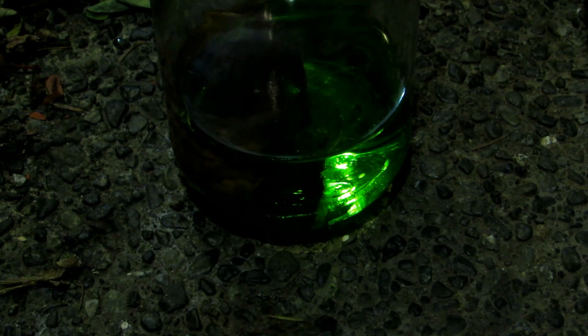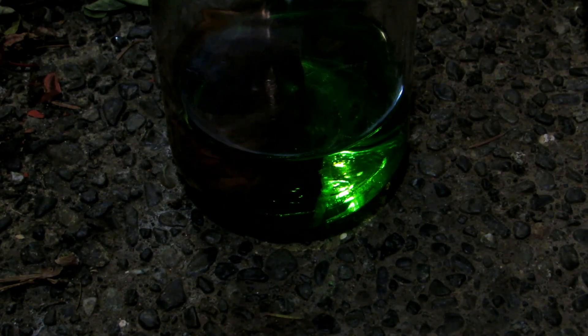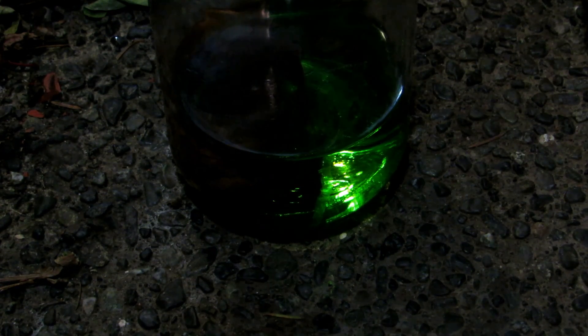You can see the nice beautiful green color — if I bring this up, it's definitely very green — as our copper is now being dissolved. There are several different ways to do this, but this is the simplest for me. Let this sit for a day and wait until all the copper metal has been dissolved. When it's all dissolved, we should be left with a fairly clear green solution.